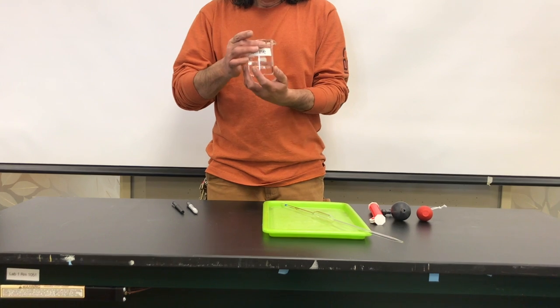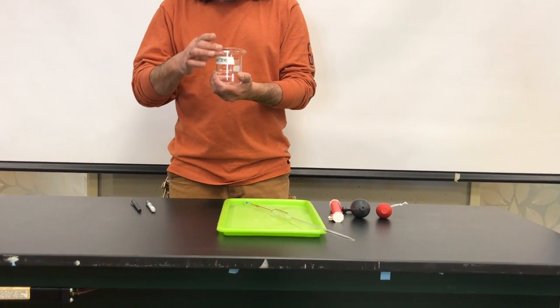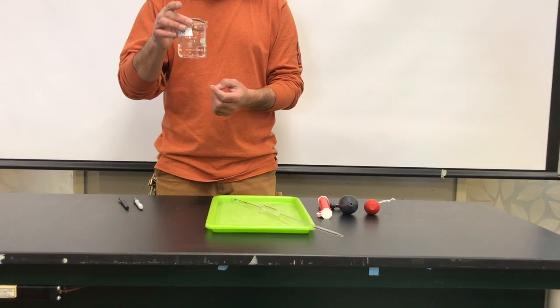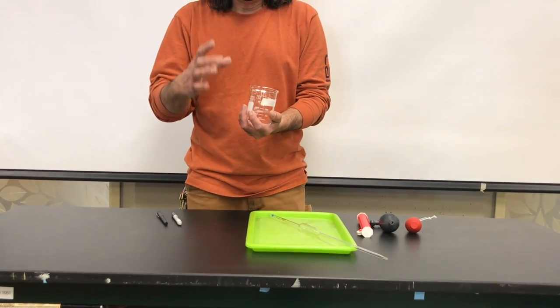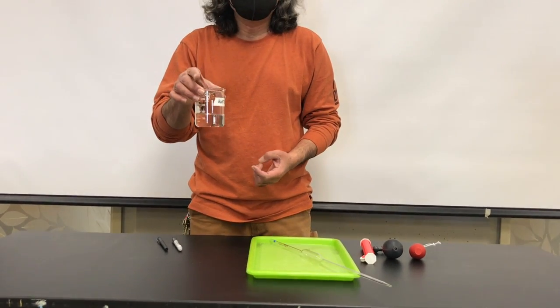When using volumetric pipettes, you always want to put the reagent that you're measuring inside a beaker. Never put volumetric pipettes inside bottles of reagents to avoid contamination.